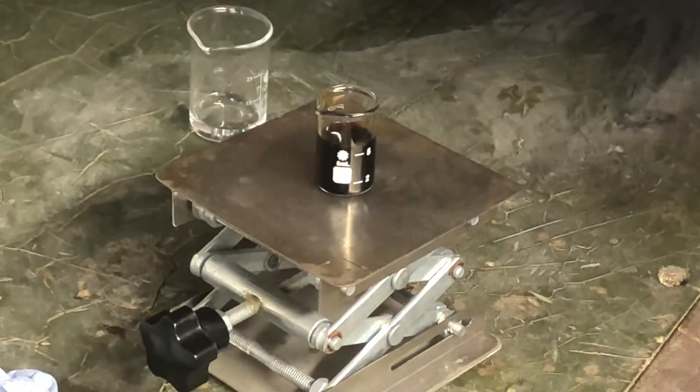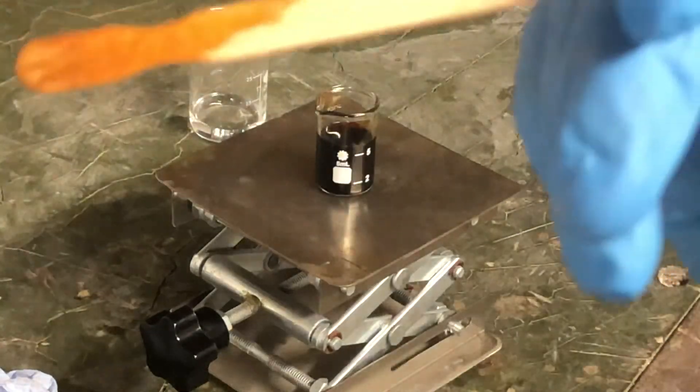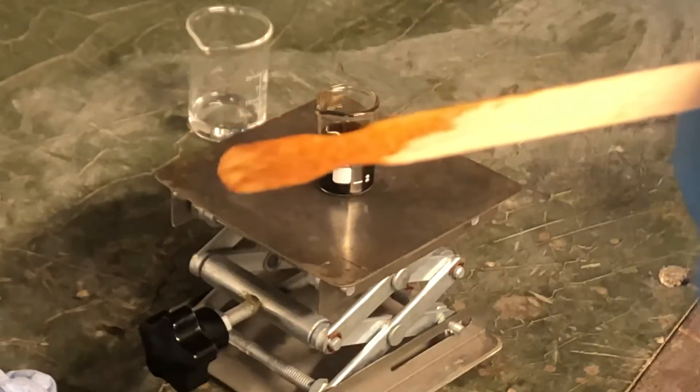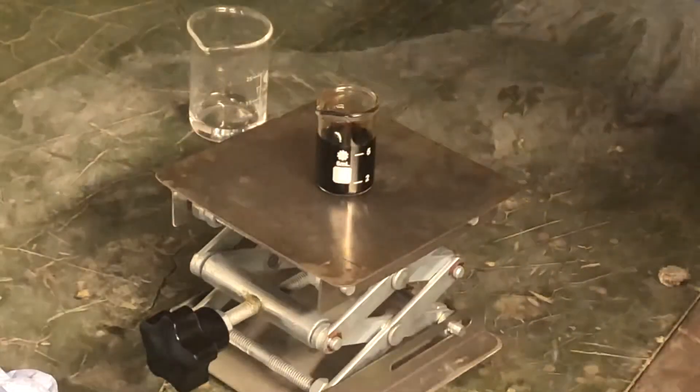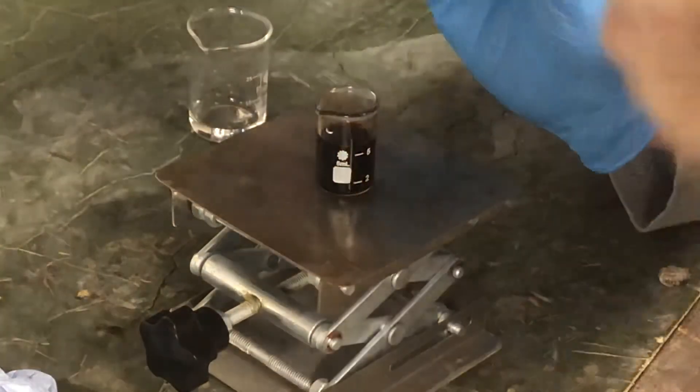So yeah, you can see how I just dipped this wooden stir thing in here, and it's singed brown because of the iodine in there.